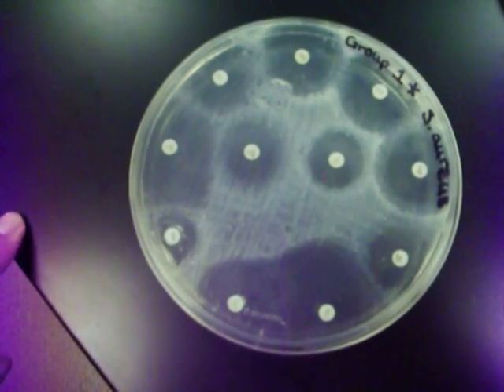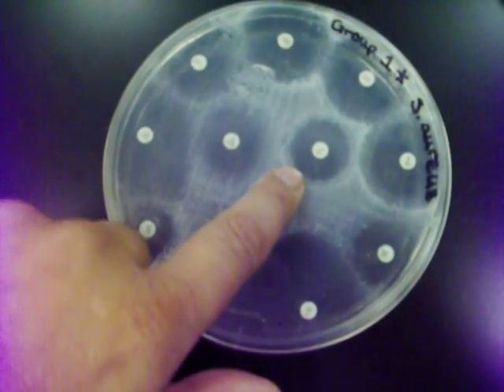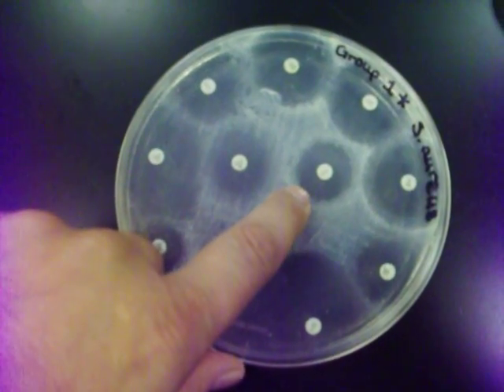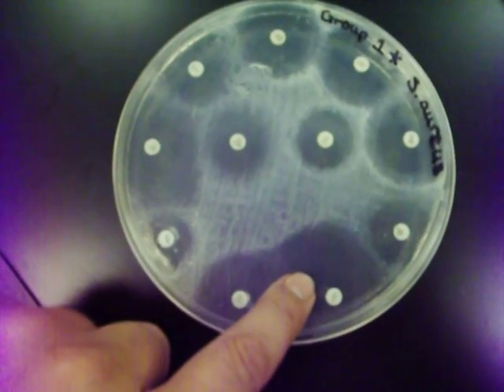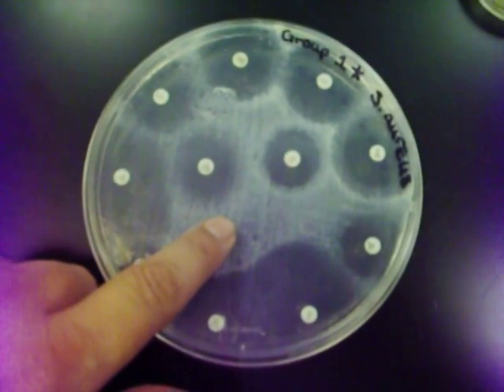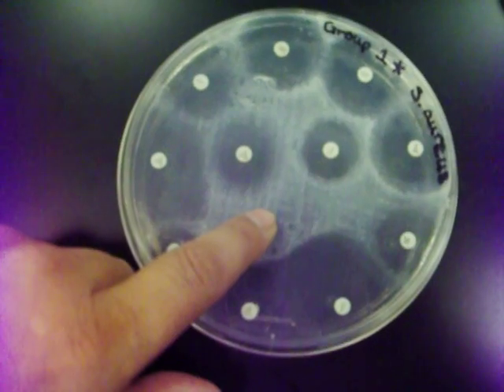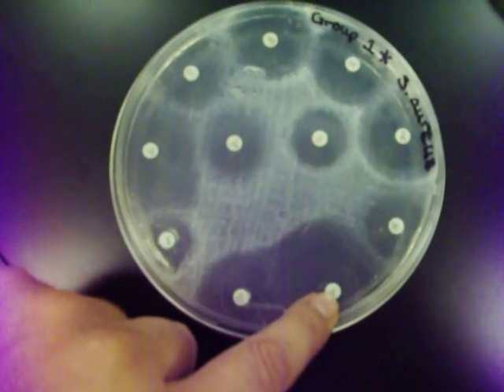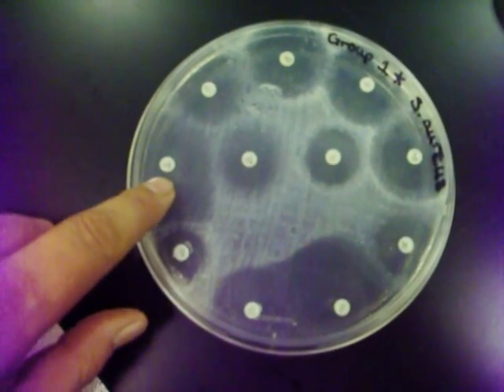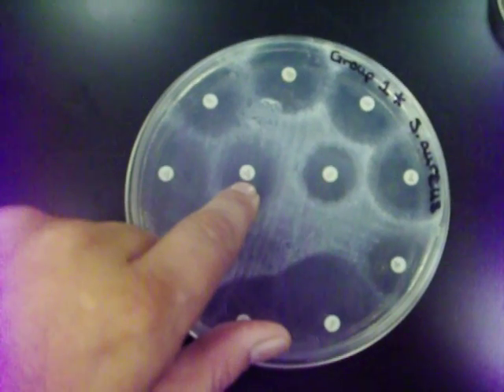For example, the smaller rings here represent a smaller zone of inhibition, and this one here has a much larger zone of inhibition. So for this bacteria, you would want to use this antibiotic or this one over here, because they have a much larger zone of inhibition compared to say this one or that one.